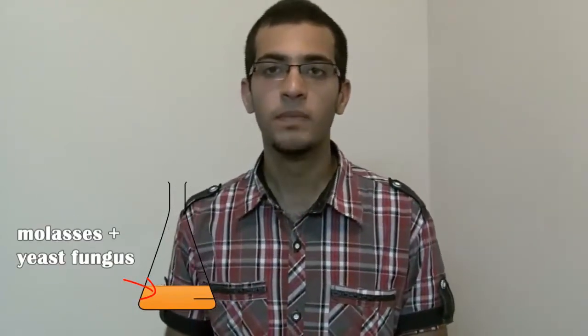Hello everybody and welcome back. Today I'll be talking about an experiment to illustrate the process of alcoholic fermentation. All we'll need is a flask. Inside this flask, we'll put a mixture of molasses or any sugar solution with some yeast fungus.